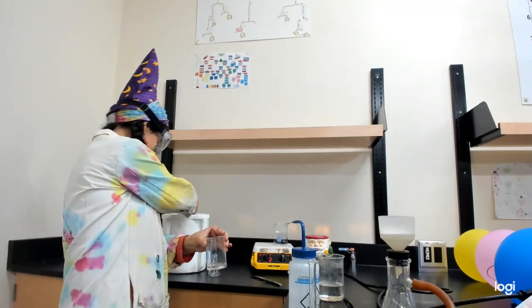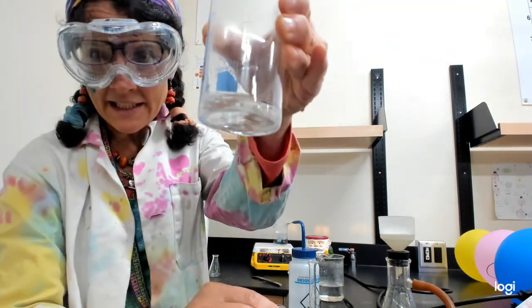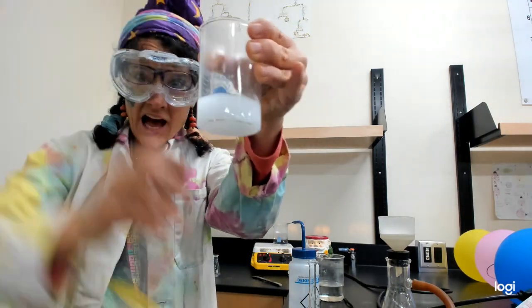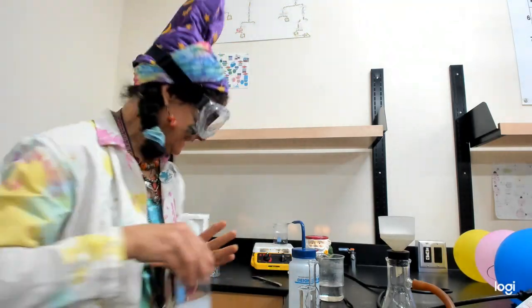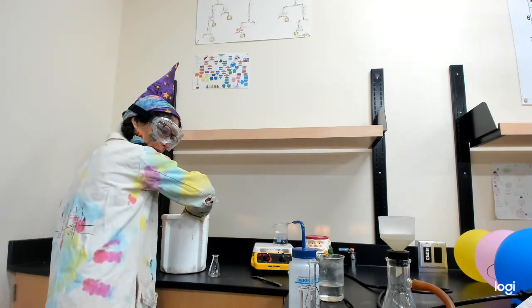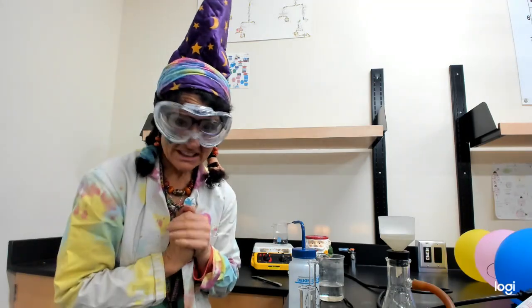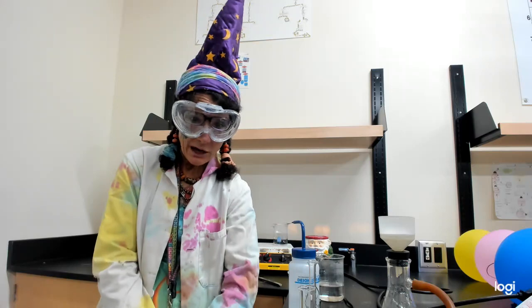You ready? It all dissolved in the ethanol. We had to warm it up a little bit. So you can see it all dissolved, and then we add the ice cold water, and we got crystals again. It's really exciting. So we'll chill it on ice for 5 minutes. We'll suction filter it again, and then we'll dry it and see how we did.